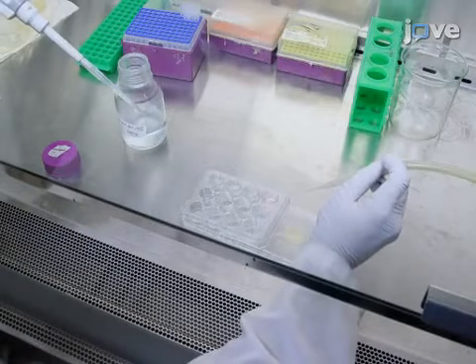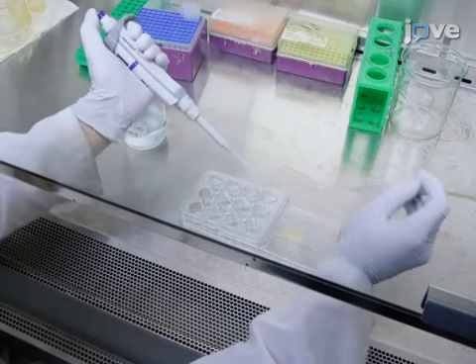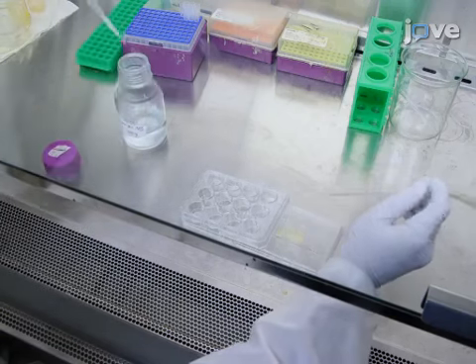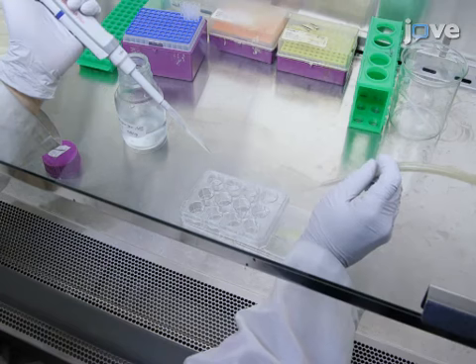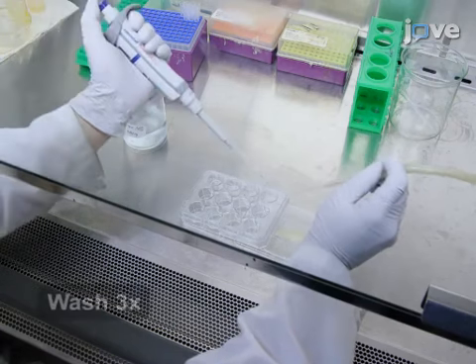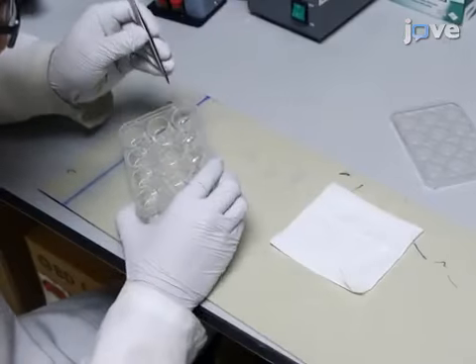Next, wash pre-transfected INS-1 cells that have been grown on cover slips with 1/2 to 1 milliliter of ice-cold PBS containing 1 millimolar EGTA. Repeat this wash 3 times and absorb the excess PBS.